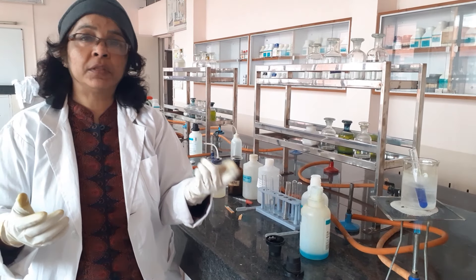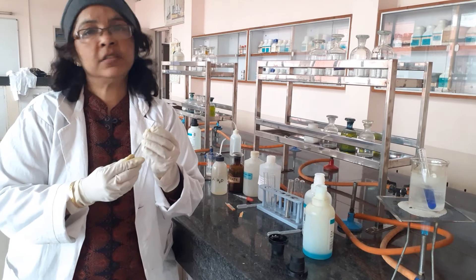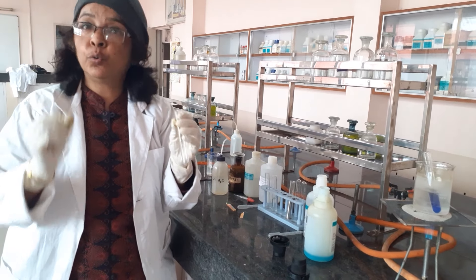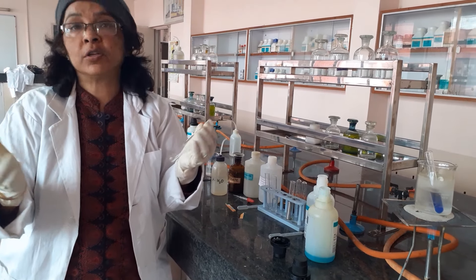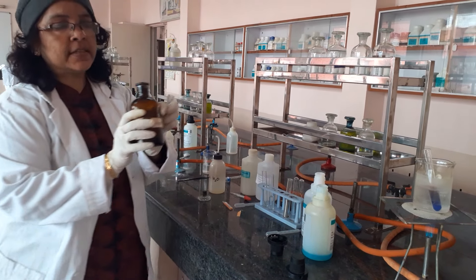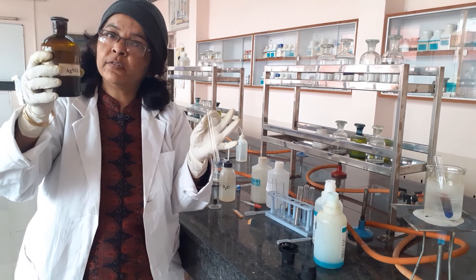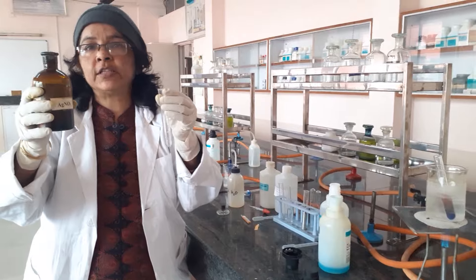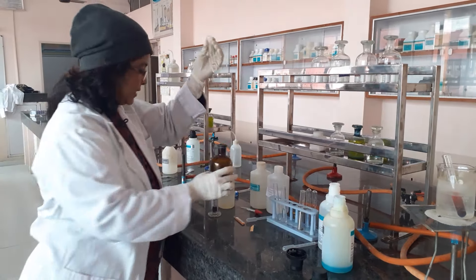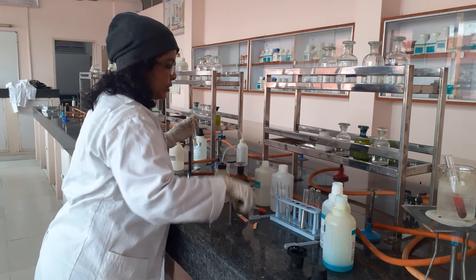For the Tollens' test, I require the Tollens' reagent to be prepared. You may get it ready-made in your labs, but you should know the preparation because it is asked in viva questions. For Tollens' reagent, you require silver nitrate solution. Silver nitrate is always stored in a dark-colored bottle because it is photosensitive. Take around 1 ml of silver nitrate solution, then add one or two drops of NaOH solution to it.